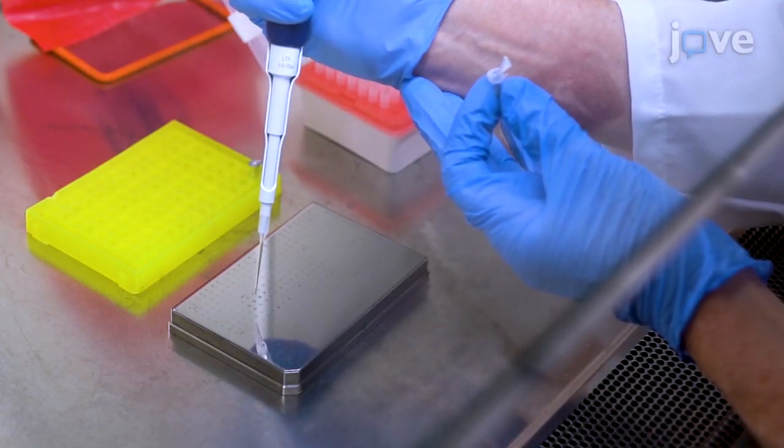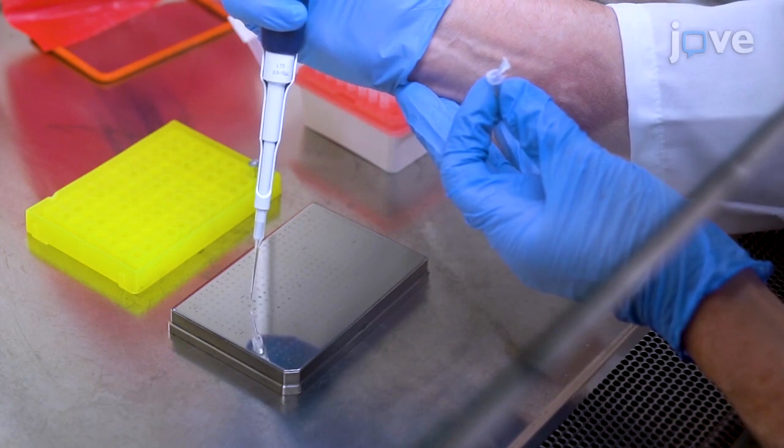The protocol demonstrates a rapid method for identification of bacterial proteins using antibiotic induction and mass spectrometry. The main advantage of the technique is its speed and simplicity. Sample preparation is uncomplicated. The technique can be extended to the characterization of any pathogenic bacteria, such as virulence factors or antibiotic resistance, to better inform appropriate treatment for a bacterial infection.